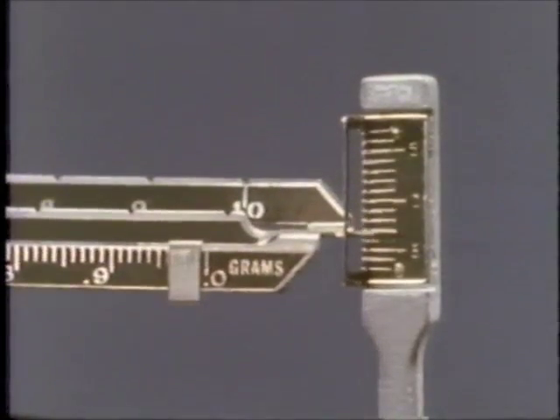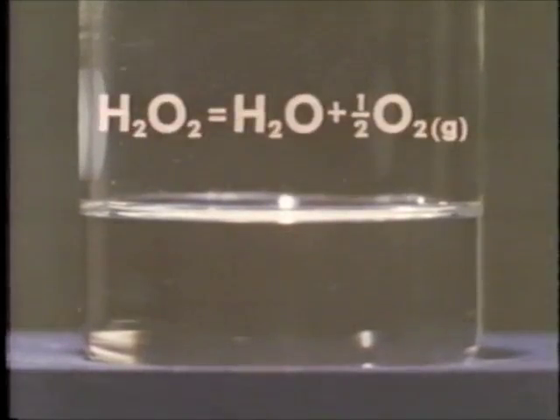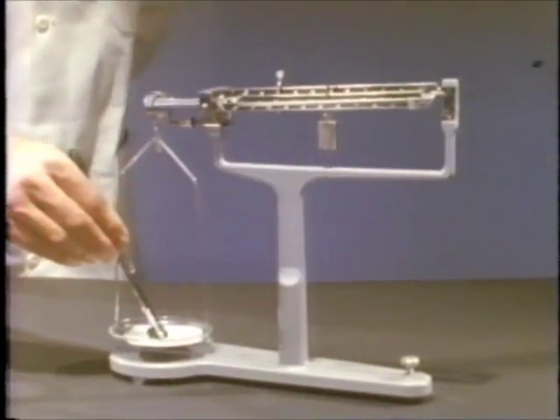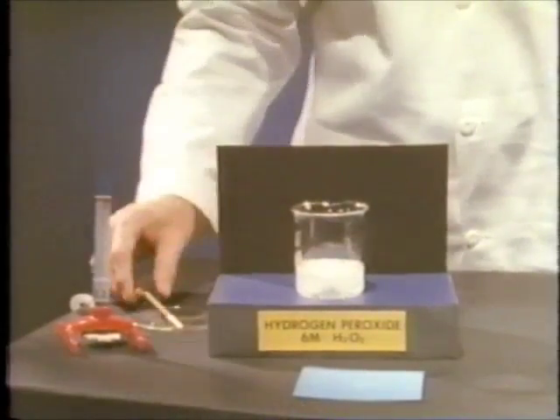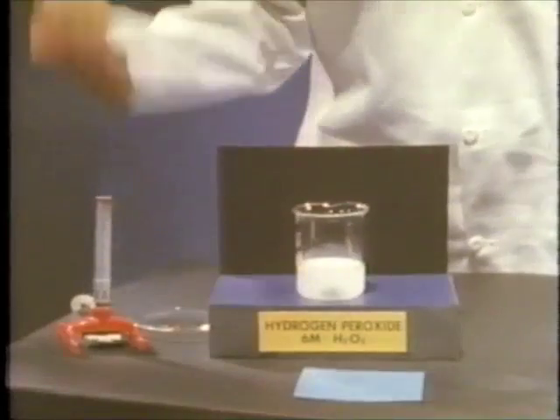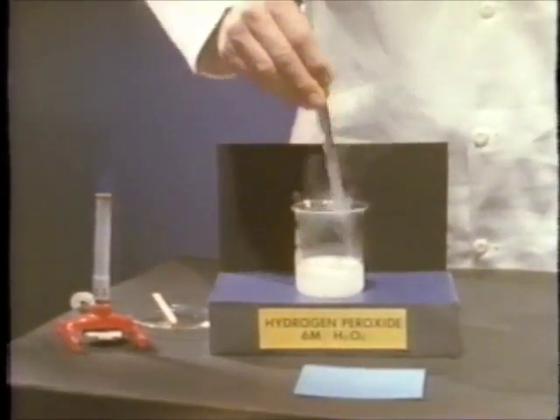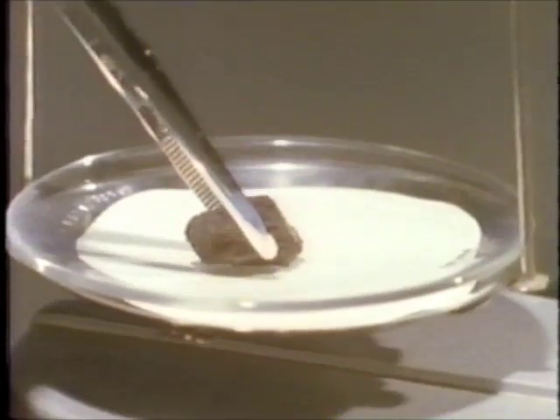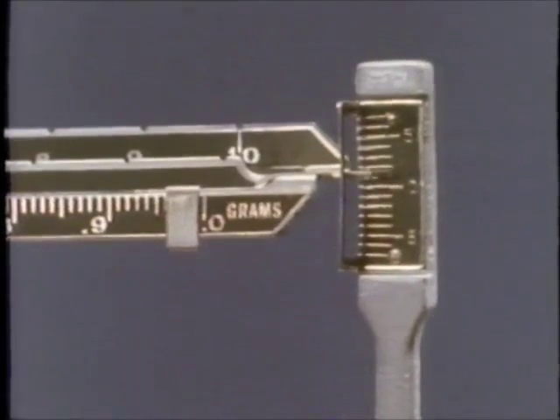We allow the manganese dioxide to dry, then establish its exact mass before repeating the reaction. The solution of hydrogen peroxide by itself looks stable, but actually it is decomposing slowly. The products are water and oxygen gas. With manganese dioxide in the solution as before, the reaction rate is again rapid. Again we allow the manganese dioxide to dry before replacing it on the balance. The mass is unchanged, showing that the solid has not been consumed in the net reaction.